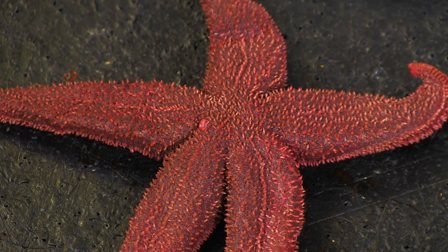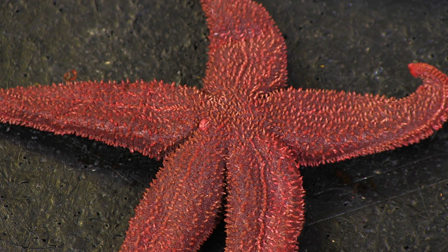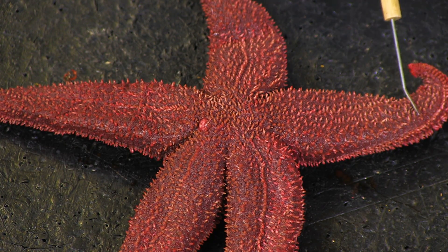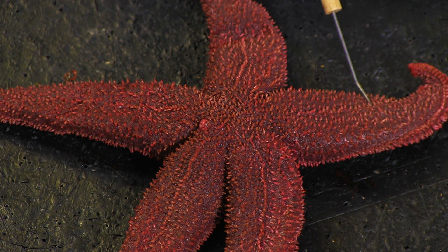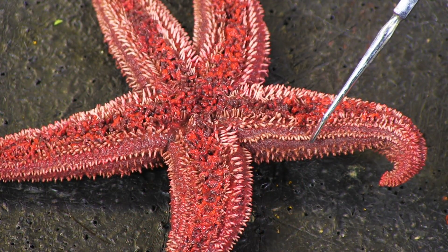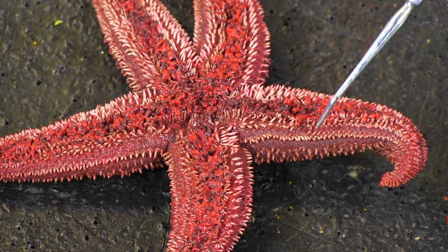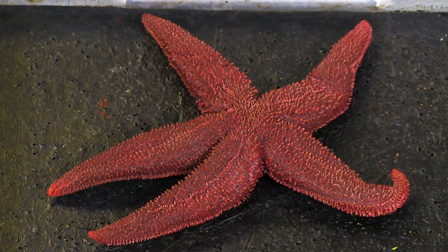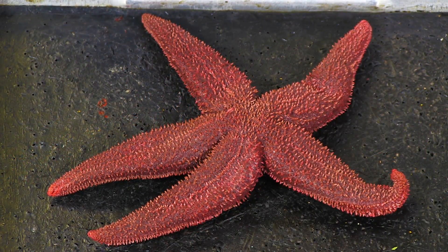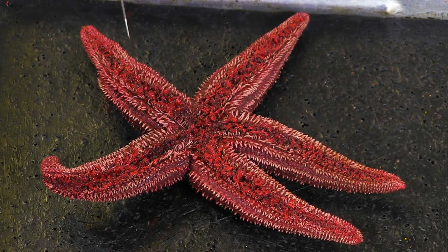The starfish has a spiny surface known as the endoskeleton, a hard structure composed of calcium-rich plates. The protruding white spines actually project through a thin layer of epidermal skin that covers the endoskeleton. The body of the starfish has an aboral, or top side, and an oral, or bottom side.